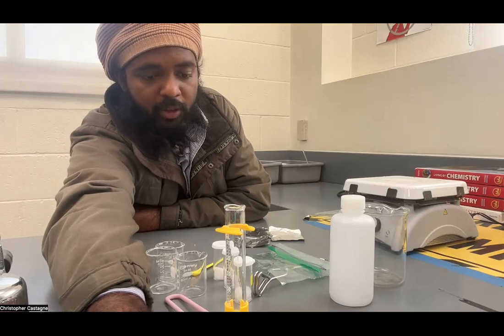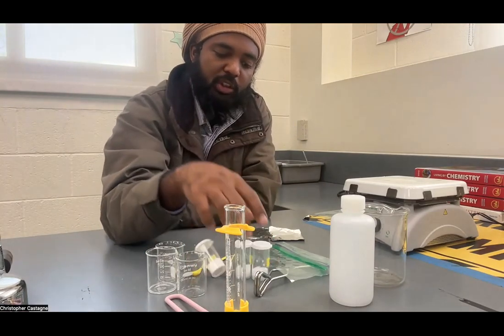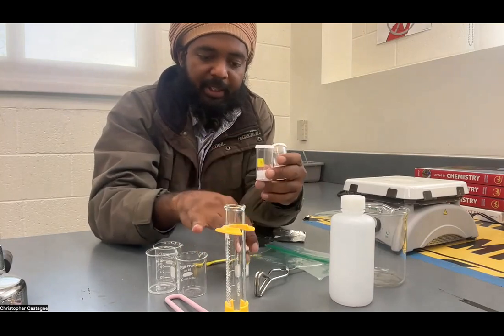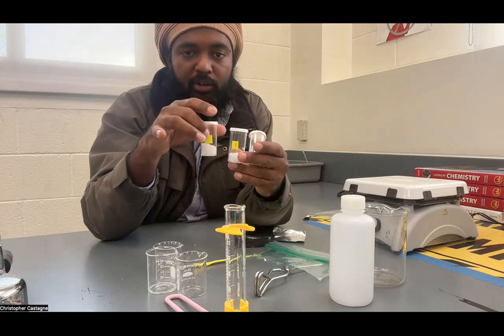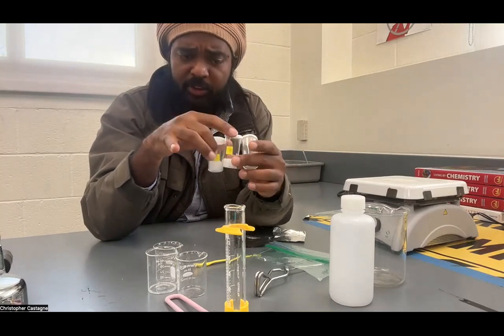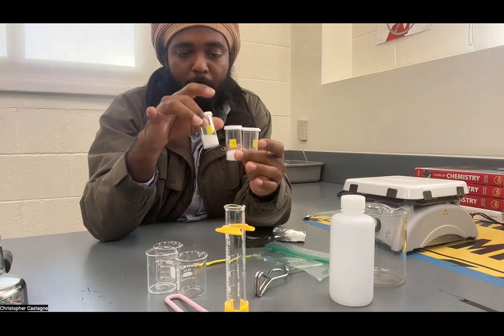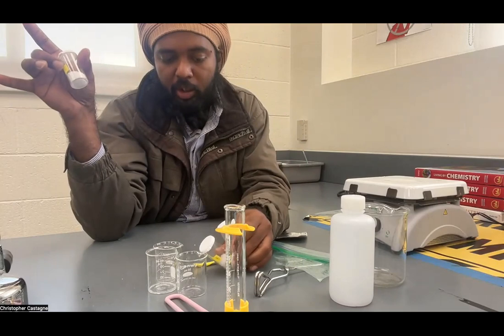We know those three are the three unknown substances A, B, and C. We know that one of these is ionic, one is covalent nonpolar, and one is polar covalent. By investigating their physical properties, we will try to identify which one is polar, nonpolar, and ionic, and therefore match these to the known compounds.